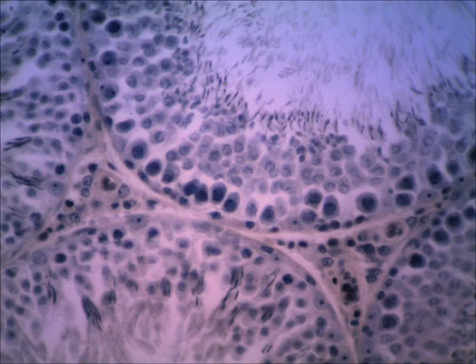On this seminiferous tubule that you see in the bottom left, these little dark dash-like structures, those are the nuclei. Now, I believe this is from a mouse, so the sperm nucleus is long and thin. It's not more rounded like it is in a human, but you still can see the immature sperm cells there.